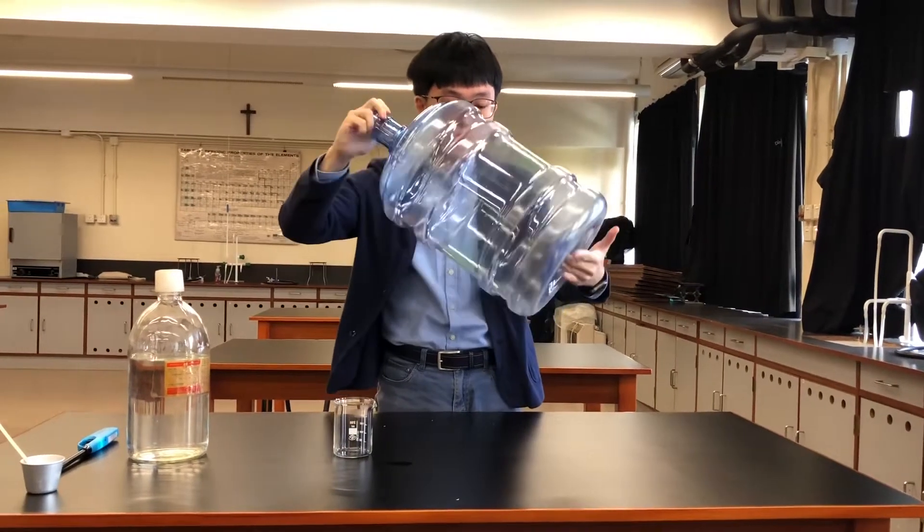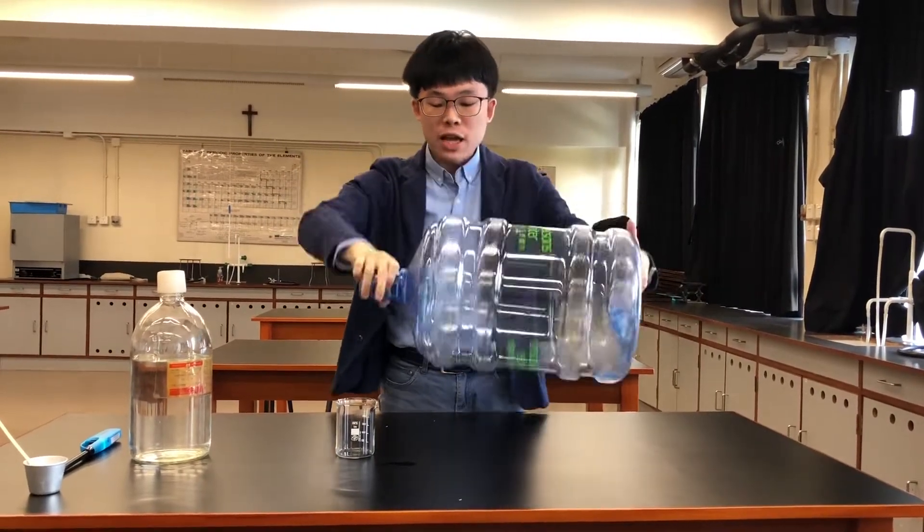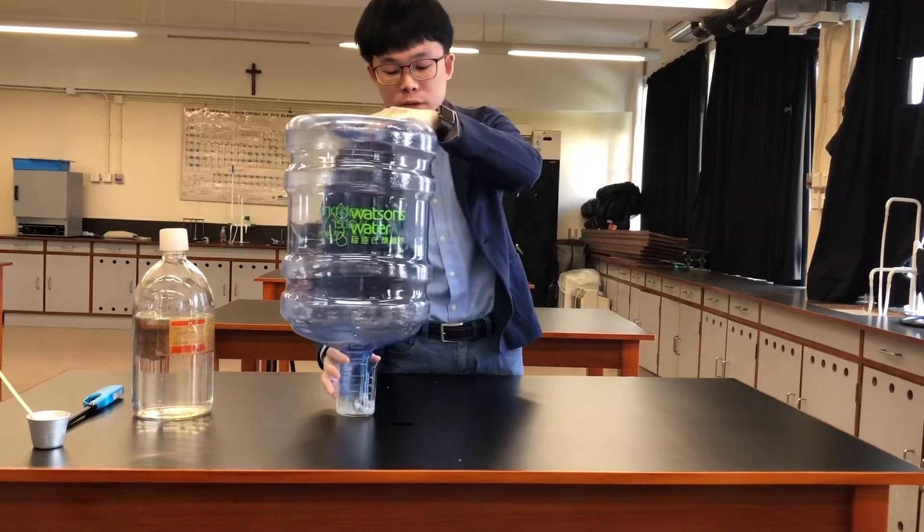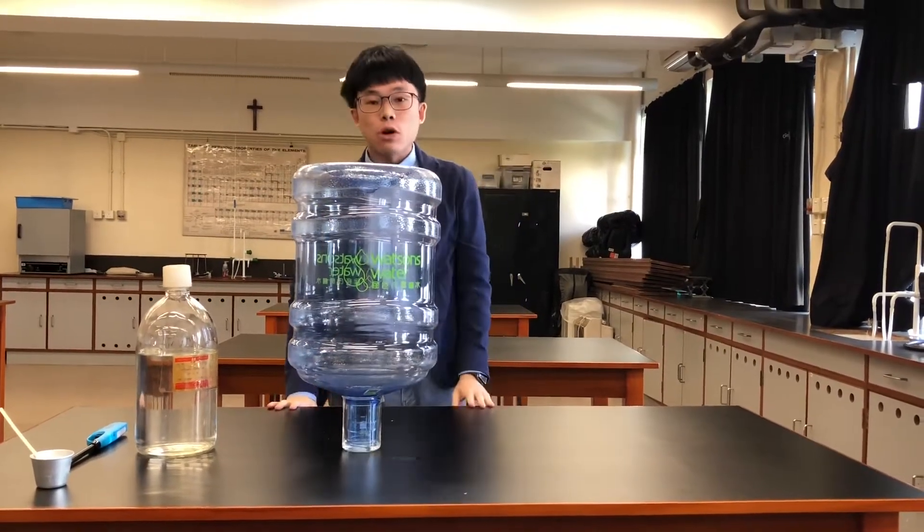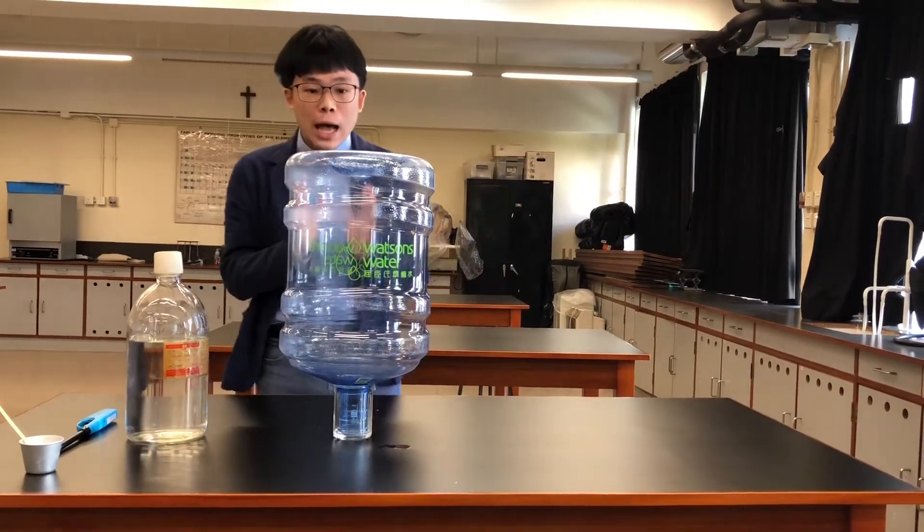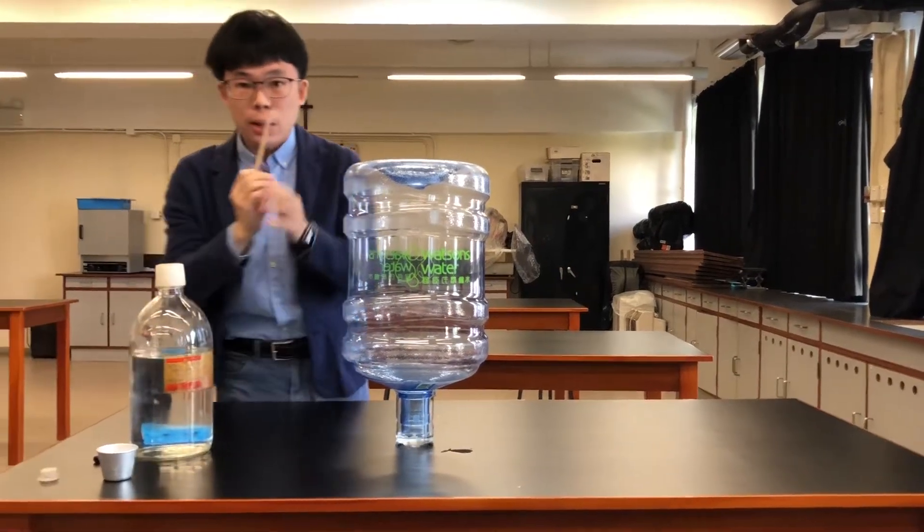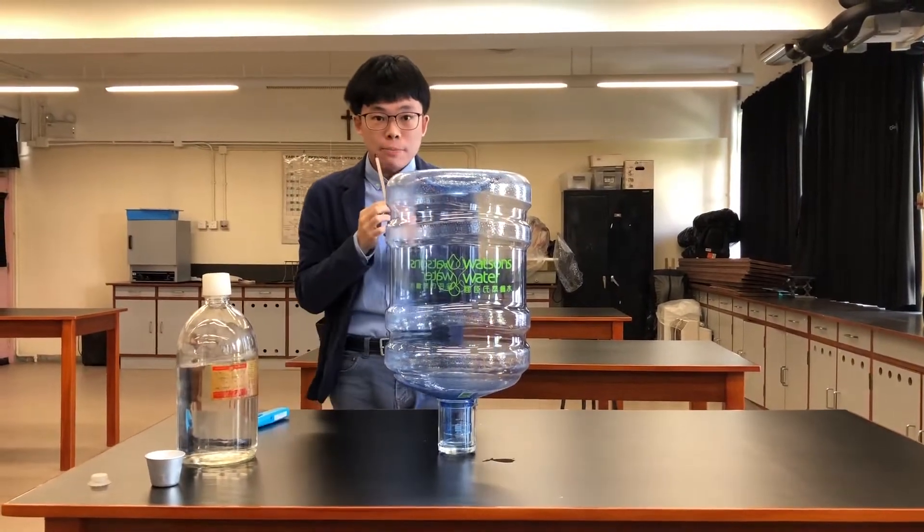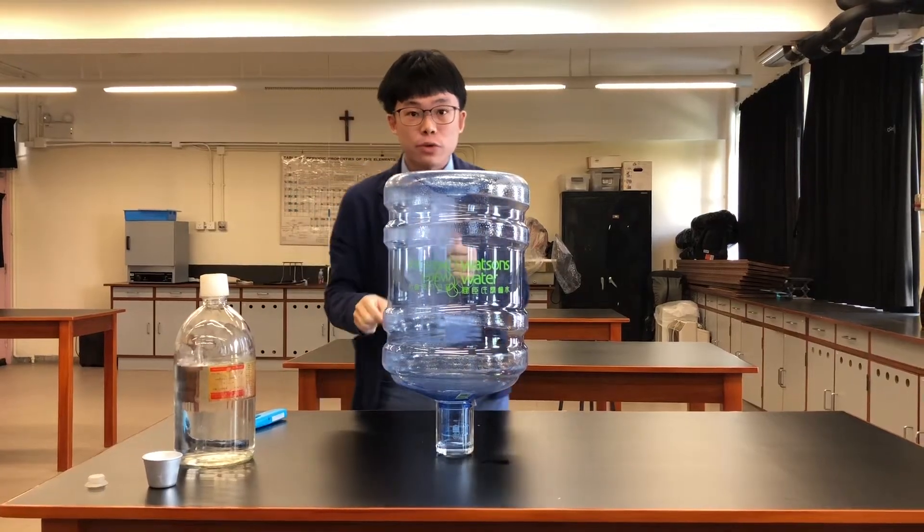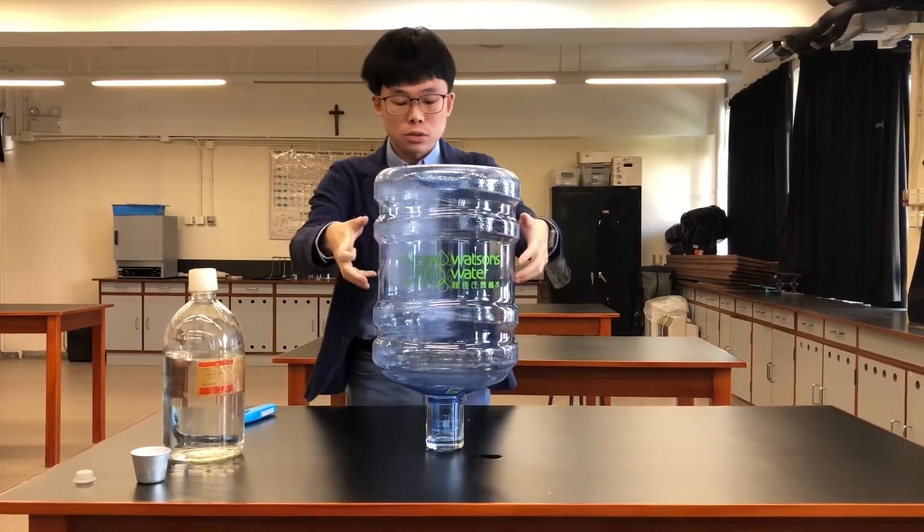The remaining alcohol I'm going to pour back into the big cup. All right, then what I am going to do right now is light up a burning splint and bring it over the mouth of this water bottle. Let's see what happens.